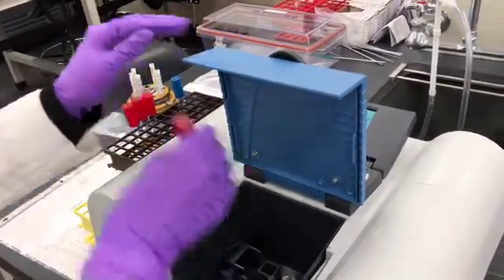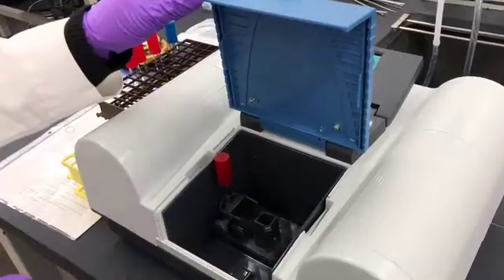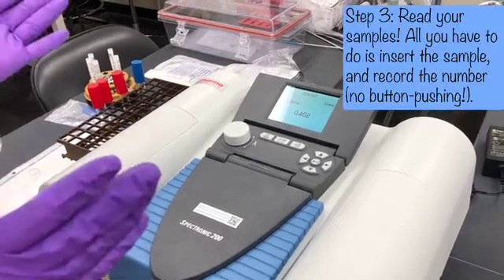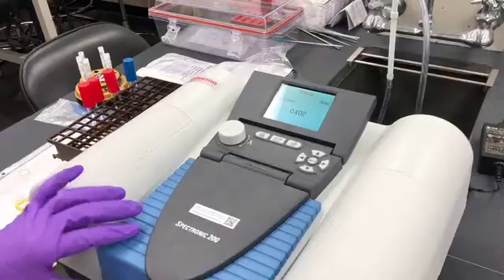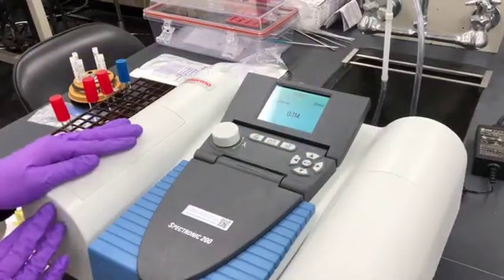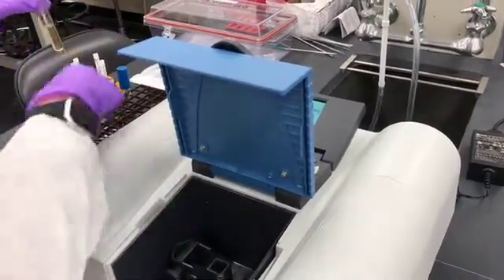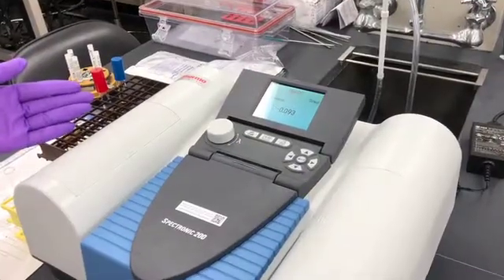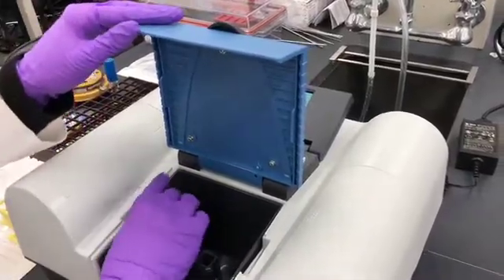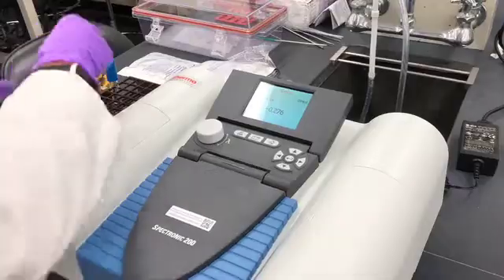Now we're going to put each of the samples in, starting with the 20 degree — I always start with the lowest temperature. I'm going to the area where you can put a round tube and it reads live; I don't have to hit enter or return. These should all be relatively close to each other, though there'll be some variability. We'll get a baseline reading for all of these and record these numbers. If I see one outlier, I might go back and re-inoculate my sample.